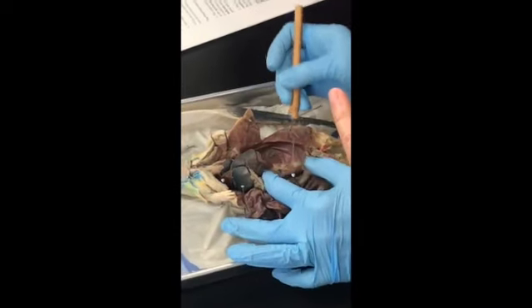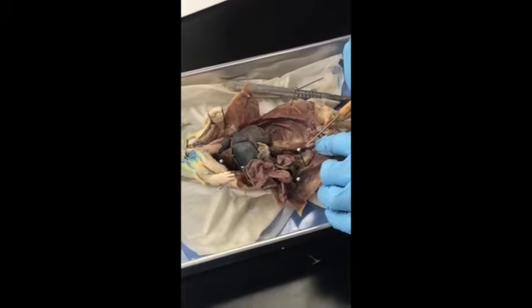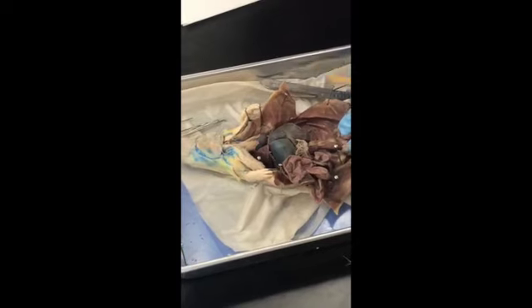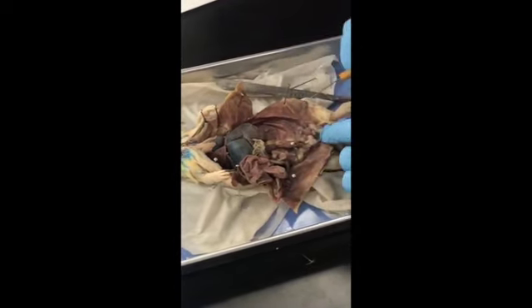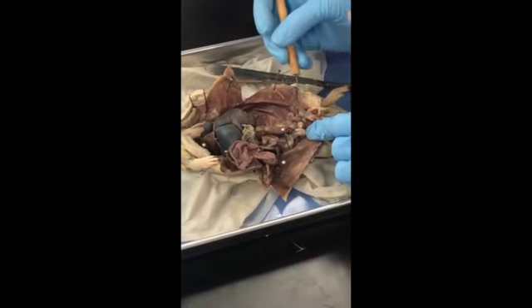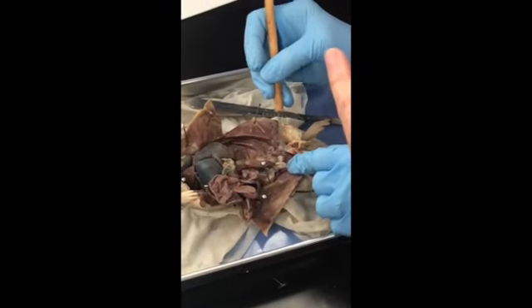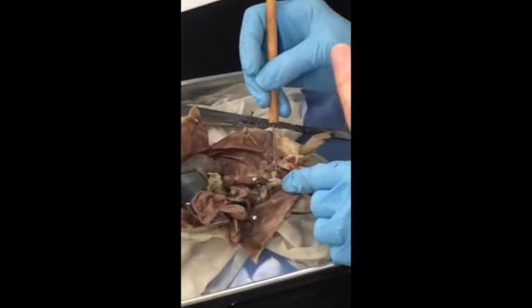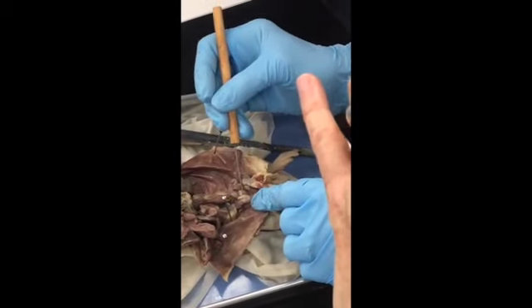ureter. Okay. Runs down to the bladder. This is the bladder. These are the seminal vesicles. They're like on either side. Okay, so there's seminal vesicles. This is the prostate. So it's very large in this rat. So again, in a male, and like a human, if they have an enlarged prostate, it pushes on the bladder and they can't urinate. So bladder first, then prostate. Think about it pushing up on it.